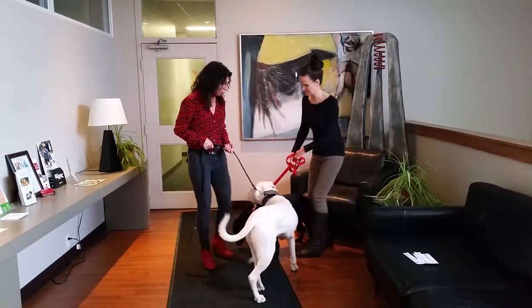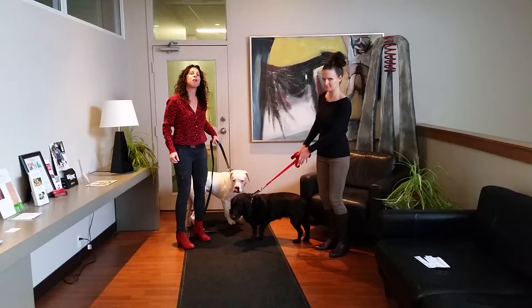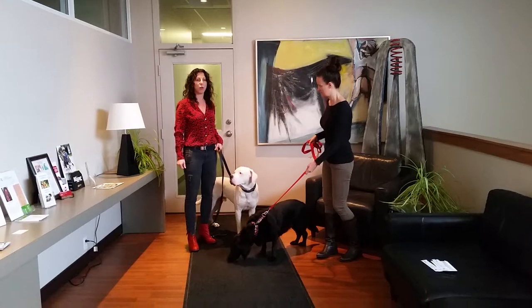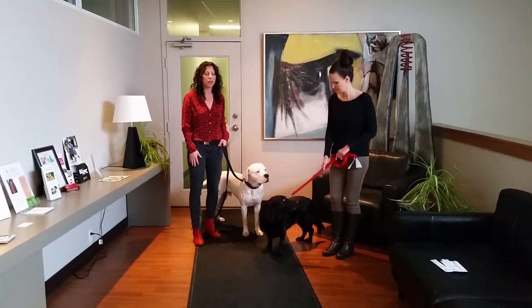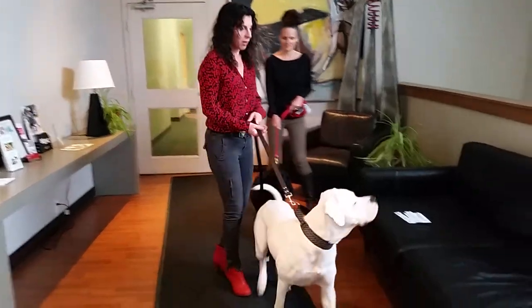The first thing we want to show you is to make sure that your dog doesn't have any oral contact with another dog before you take your sample, because that dog's cells might show up on this dog's sample and this dog will report back with the wrong breeds. So if you can keep your dog separated for an hour and make sure that they don't share any toys, that's going to be your best bet.